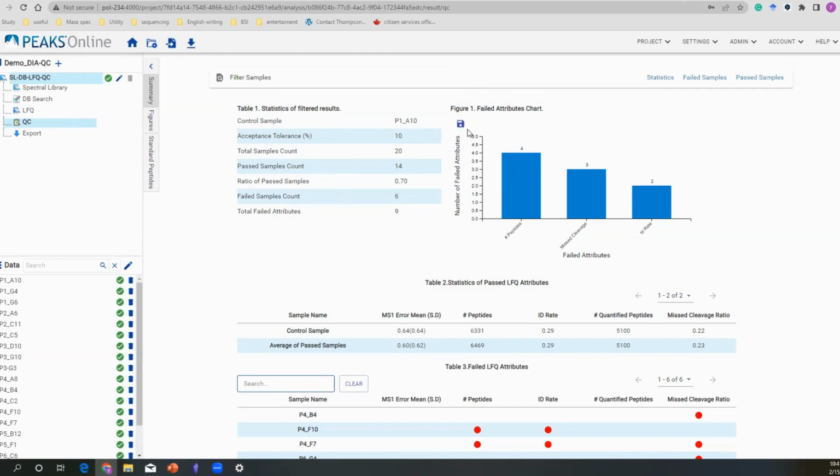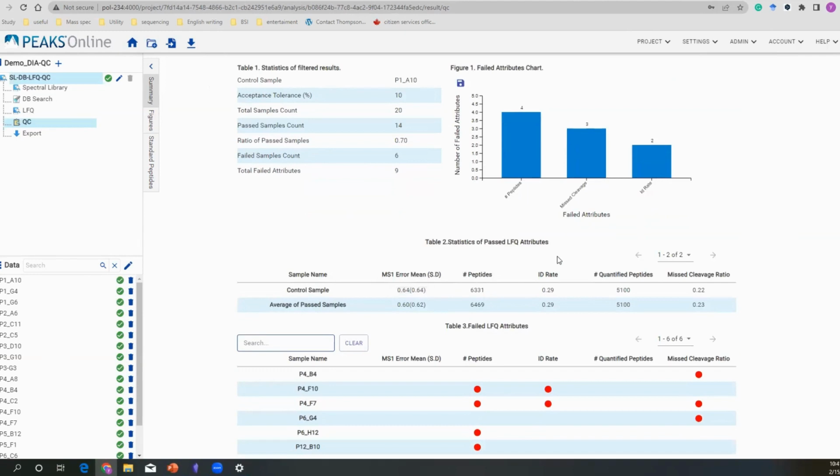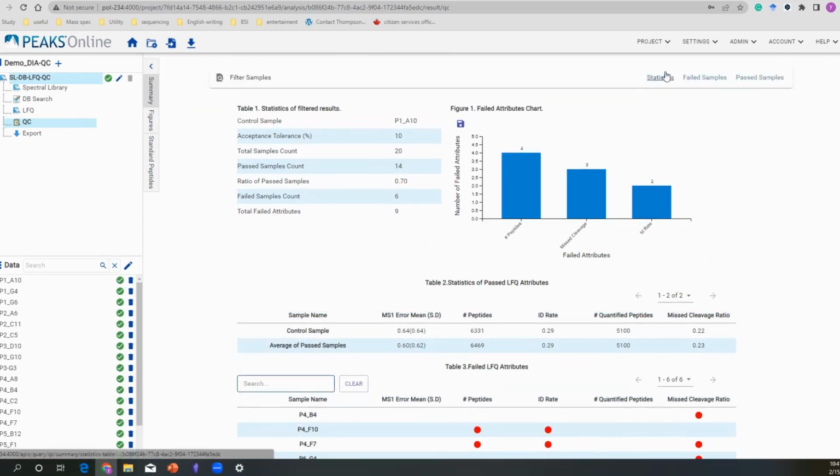Oh, here it is. By a single click, you can export your PDF. In here, you are seeing your passed label-free quant attributes, and you can see your failed ones and how their attributes are distributed. It may not be only one, so every one is highlighted with a red dot. Also, by a simple click in here, you can export the statistic information about your failed and passed samples.